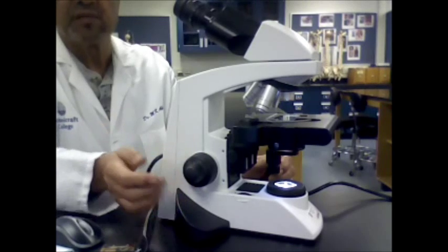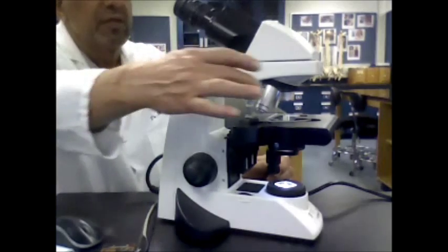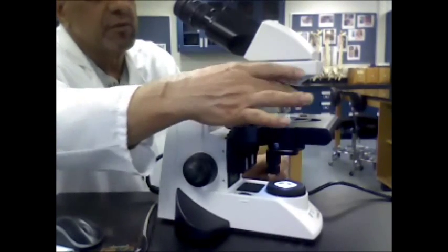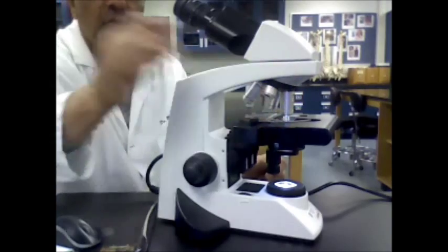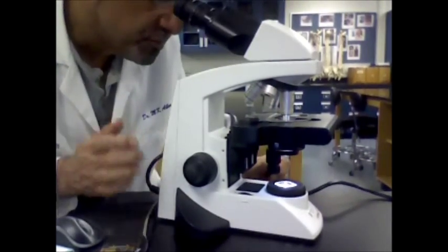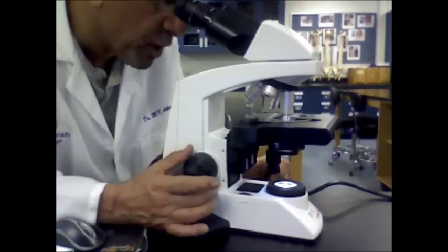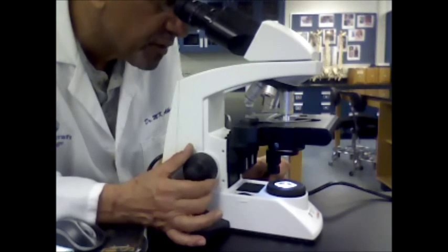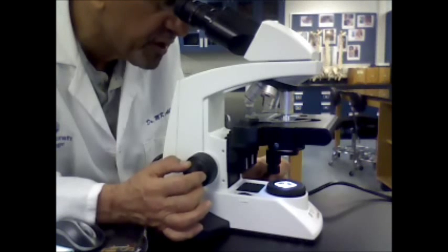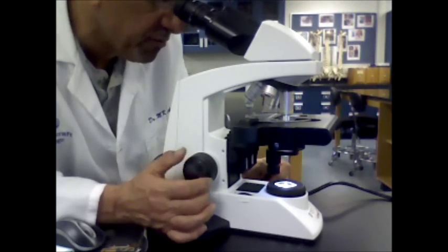After you focus the specimen on the low power, you can go ahead and switch — in this case from the scanner to the low power. Look through it and be sure your specimen is in focus. If it's not, with the low power, you can use the coarse adjustment knob to focus first, and then use your fine adjustment knob for fine focusing.